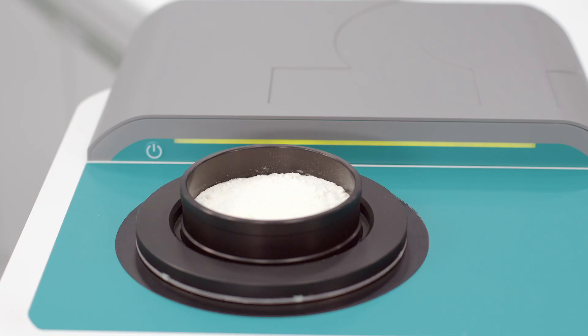The cup will rotate and measurements are taken at different positions. This will result in an averaged and more representative spectrum of the flour sample.